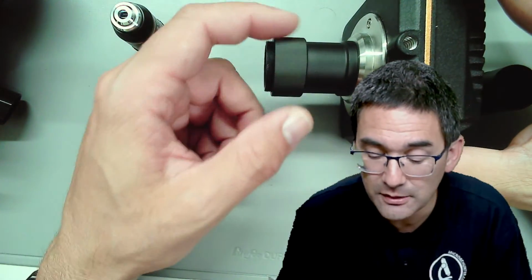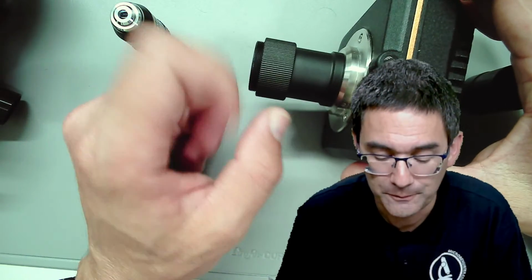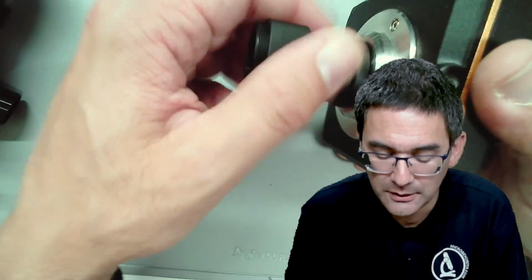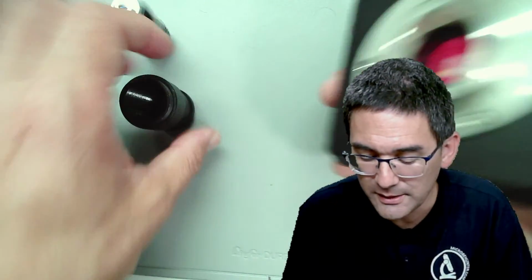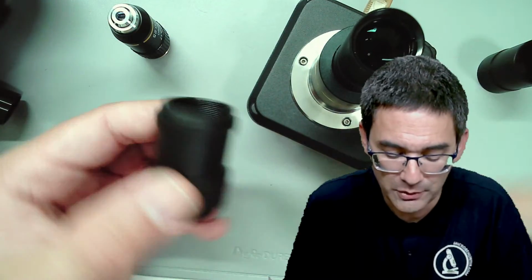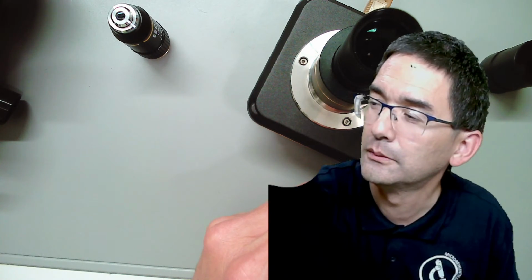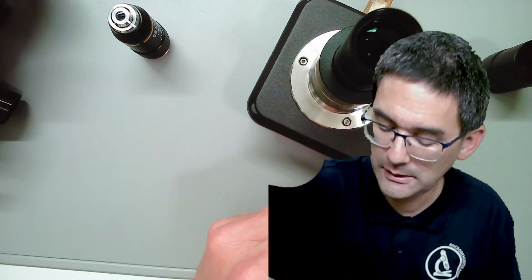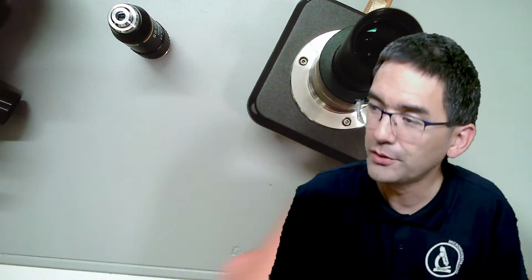So you'll get a lot of additional magnification. This is of course a disadvantage. I'll try to detach this again and we can have a look at this. What I will do is connect the reduction optics again. I have to connect this part again to the microscope, which you're not able to see right now. I'm reaching over. It's the other way around. And I also have to connect, of course, this top part.